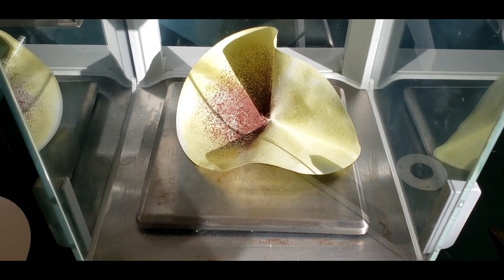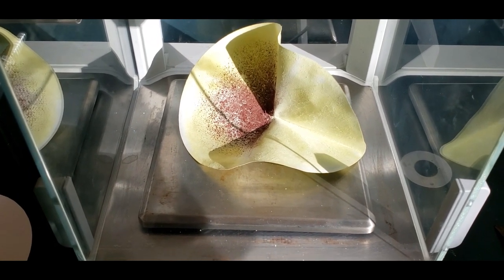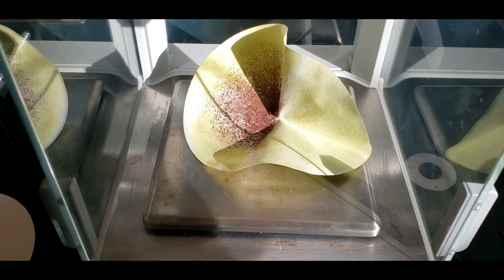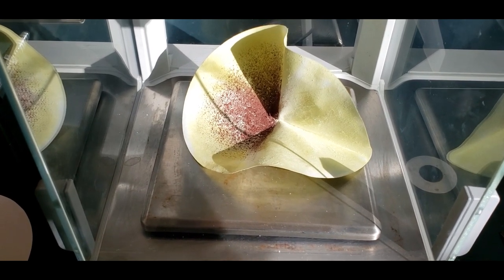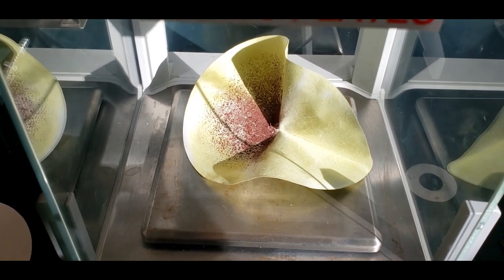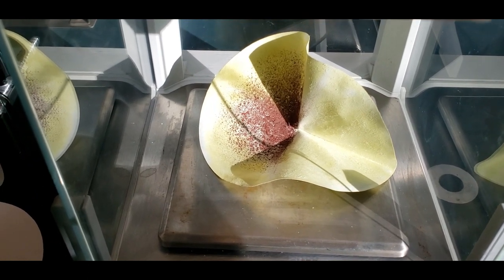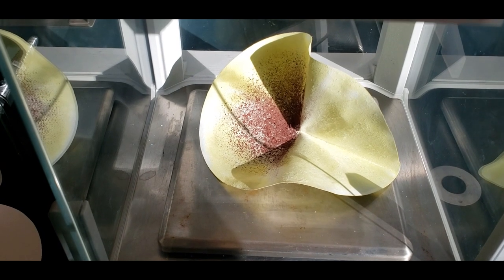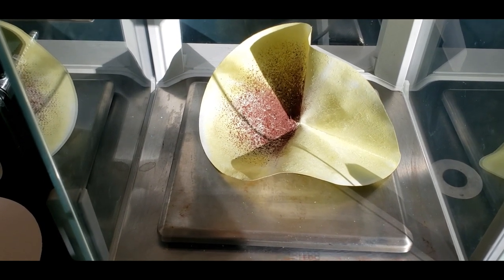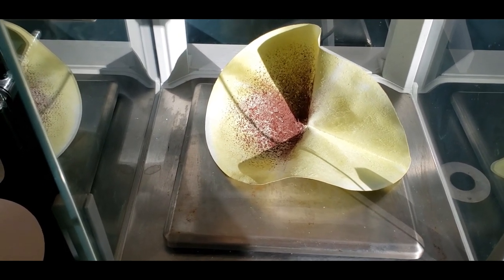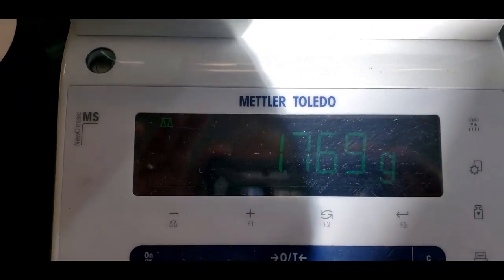To save some time, I've done the filtering and the drying of the copper off screen. So I'm just going to weigh it now and get that last data point. So there's the copper. You can see that the filter paper is kind of crinkly, couldn't even open it up completely because it's so dried out. And here is the mass.